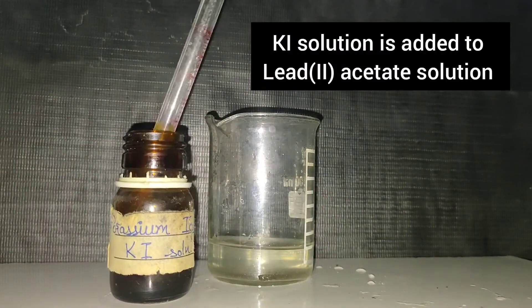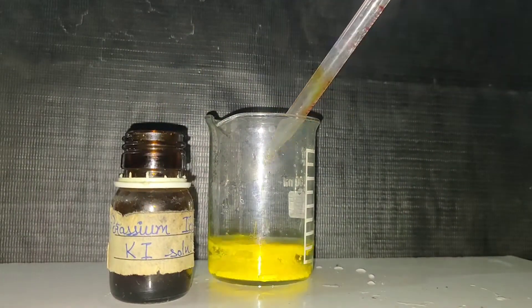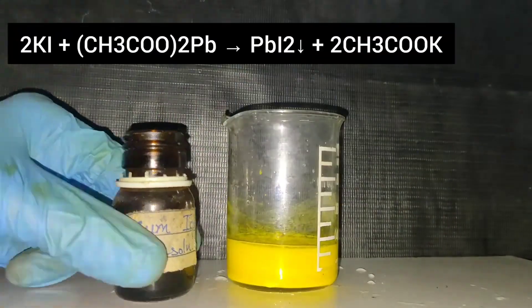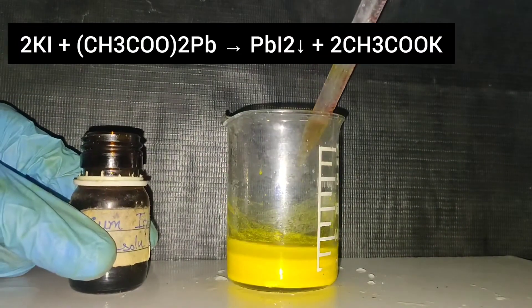In this video we will be preparing lead iodide. In the beaker I have lead acetate solution, which we prepared in the previous video. And to this I am adding some potassium iodide solution.